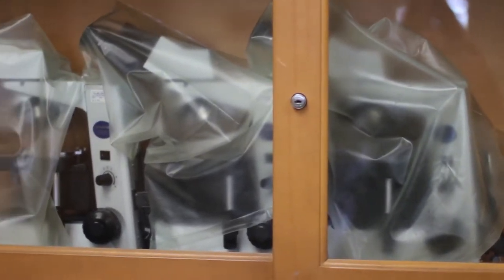Microscopes are a valuable and useful tool in the biology lab and are very expensive and delicate. It is important that as a biology student you become familiar with the parts and care of the microscopes available to you here at Gavilan College.